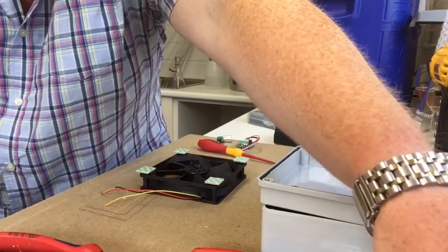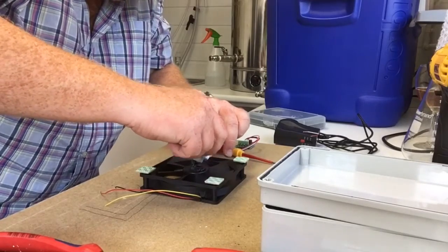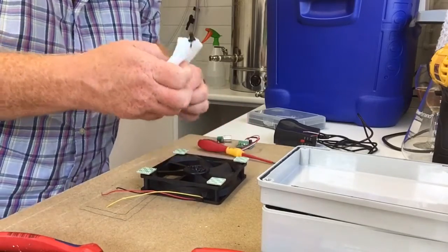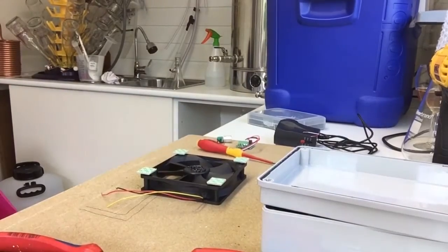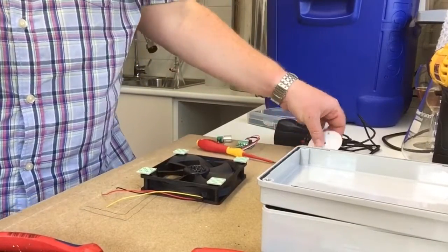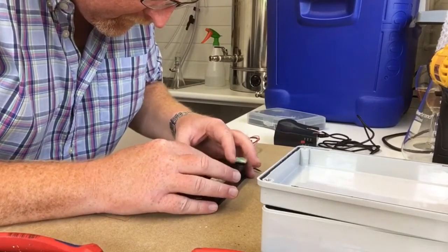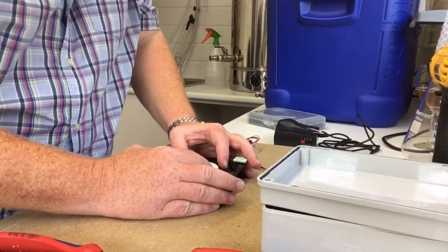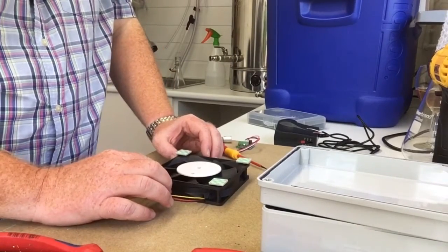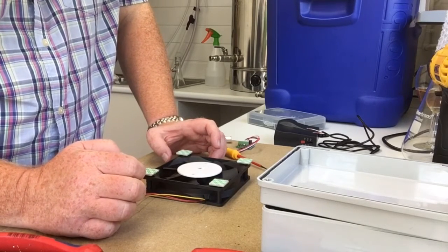See, now, before I decided to stick my finger in it, I could see the centre just fine. So, just a second. Oh, it's going so well. Perfectly centered, so I'm not going to play with that too much. I'll come back to you shortly. I'm going to go and pick the missus up from the beach and I'll finish the job off. Speak to you in a minute.